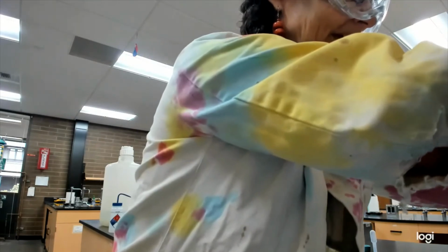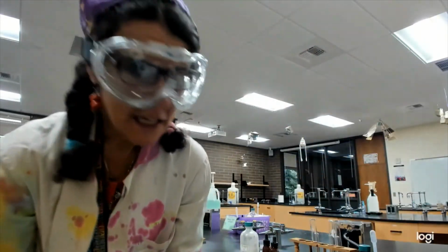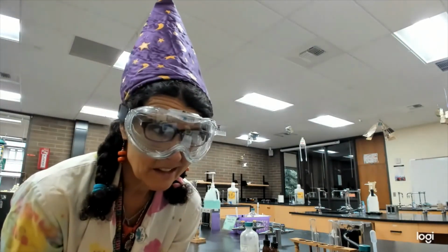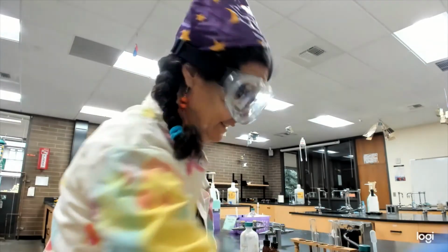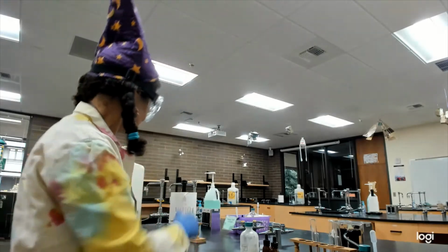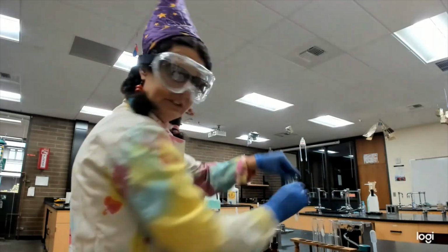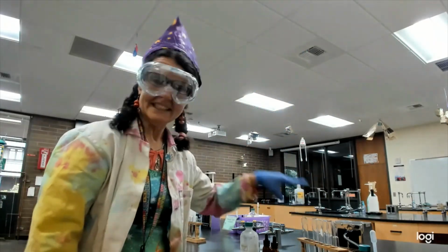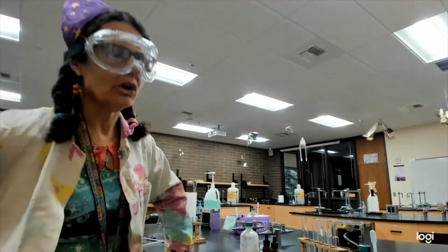So, we're going to put it in our hot water. And we're going to see. And while they're heating, secondaries will turn cloudy with heat. The primary takes like an hour. So, while it's heating, let's just move on to the next test. We need 2 more test tubes. Let's get rid of our tertiary. It's really cool cloudiness. You guys can even write out the reaction. It's an exchange reaction. The alcohol and the chlorine.